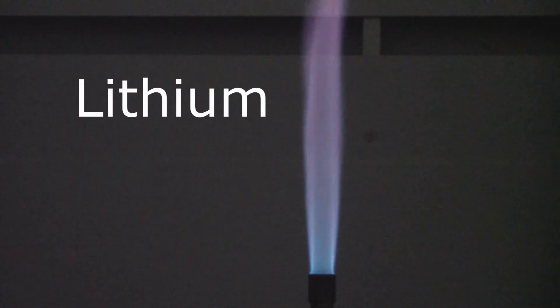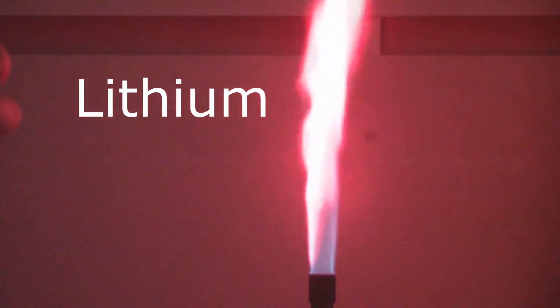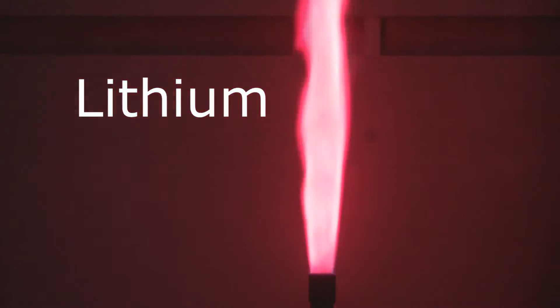Alright, so let's zoom in so you can get a better look at this. I'm going to start out with the lithium ion. Let's spray it on in. And you can see we get this beautiful dark red color.